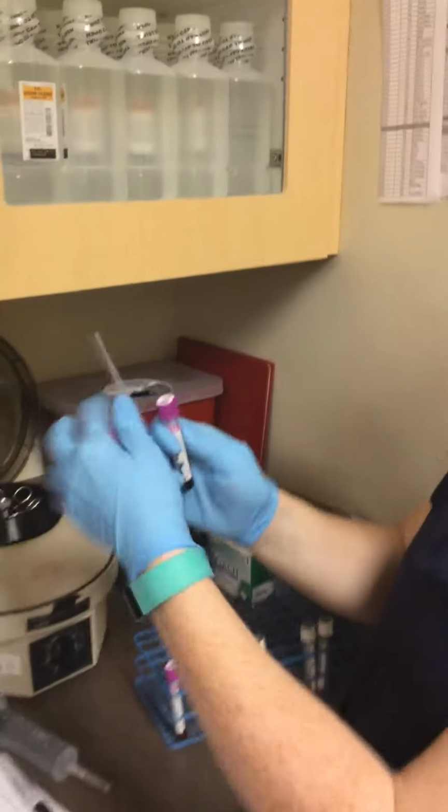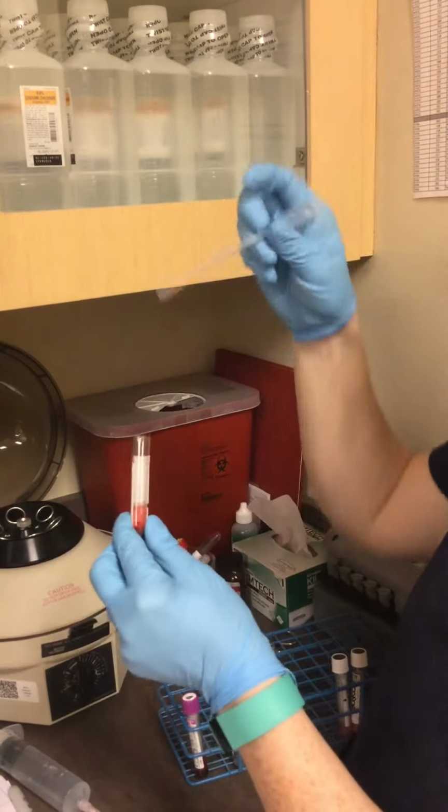So this is the saline here. So again, this is the 3rd time that I've done this.